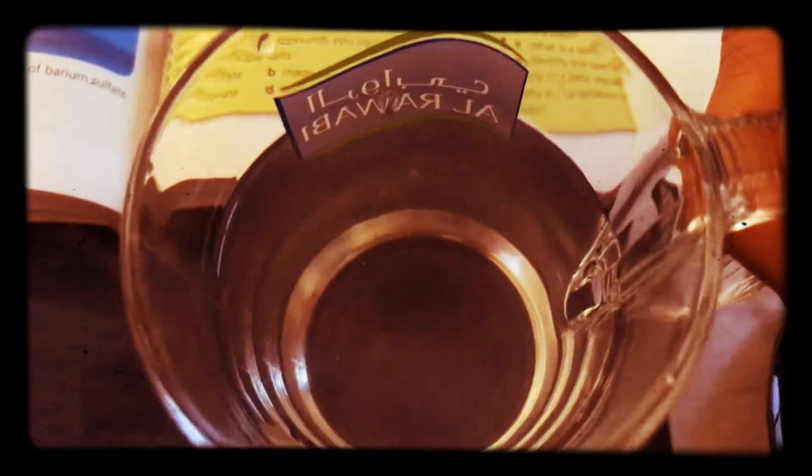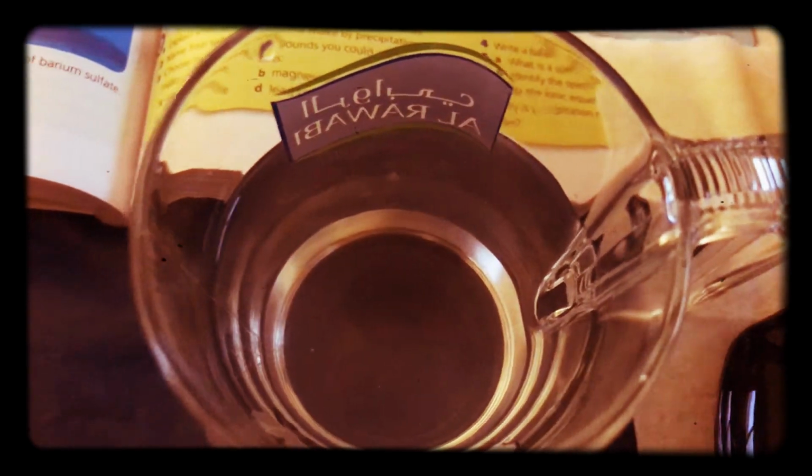These ions have certain charges, and those charges have positive charges and negative charges. Some of them may be multiple ones, but the vast majority of this, in fact, I can't see any crystals left over. The salt has dissolved, completely dissolved.